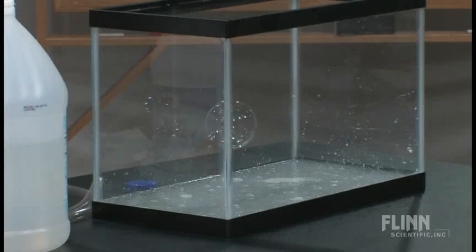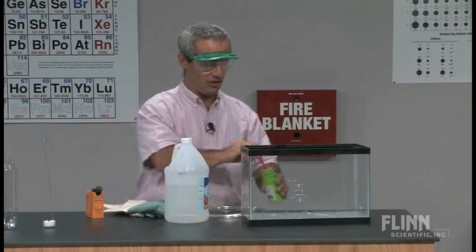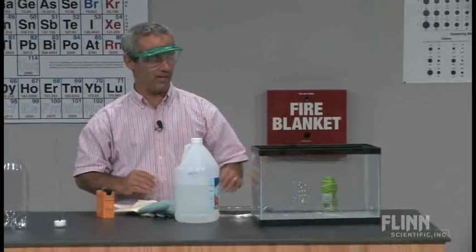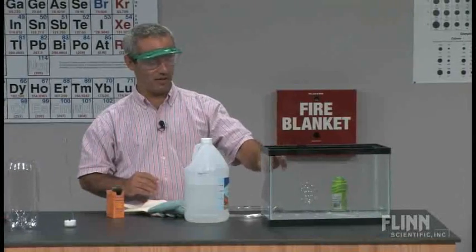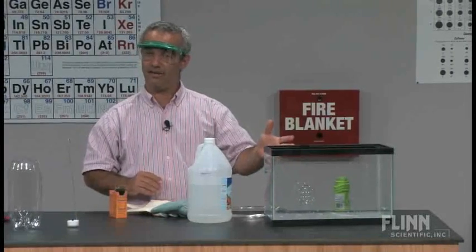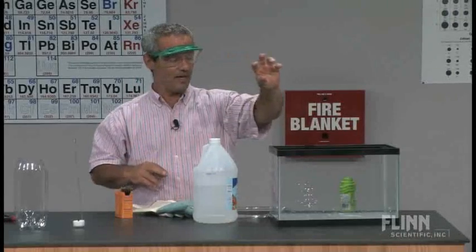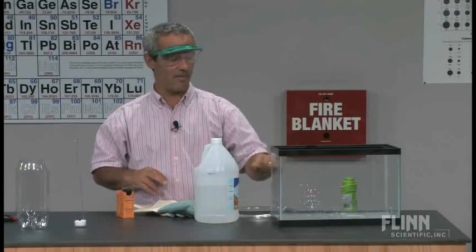So levitating bubbles, a nice little demonstration of it. That CO2 sitting down in there like a layer of water, a layer of liquid, and that bubble just kind of floating on it because that bubble is full of air which is more dense than the surrounding air because of the soapy water, but it's less dense than the carbon dioxide layer.